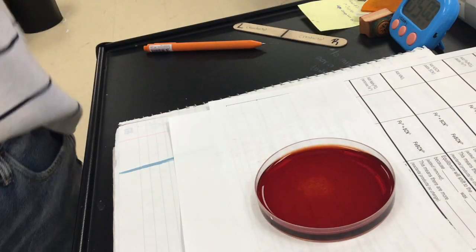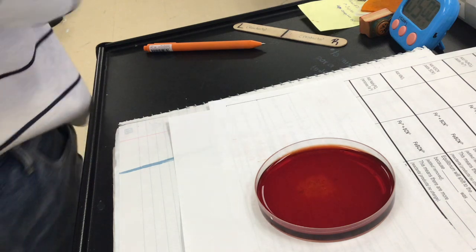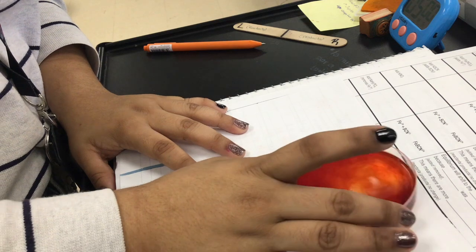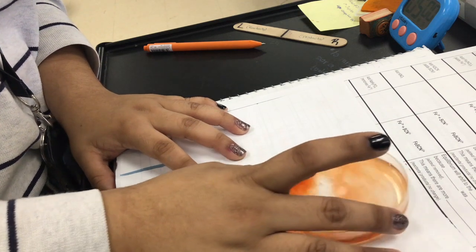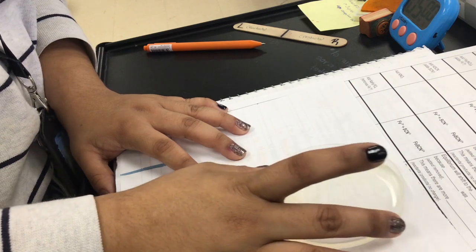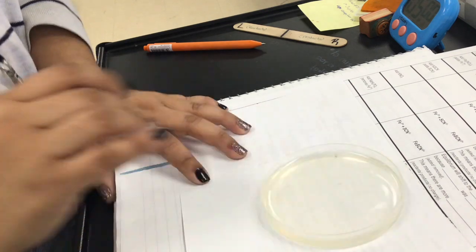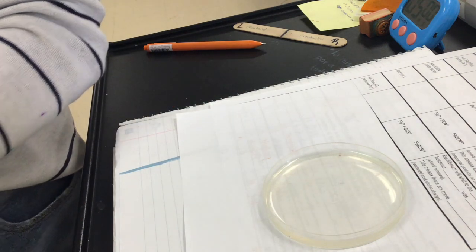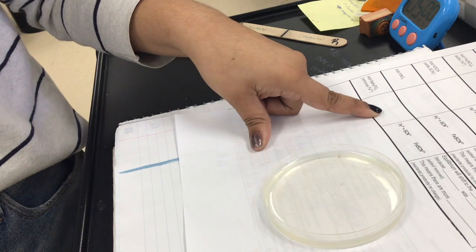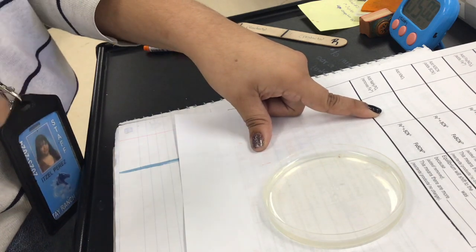Okay, we're removing Fe, so the reactants are being removed. Okay, what color is it now? Clear, colorless. So can we write it down for sodium phosphate right here?